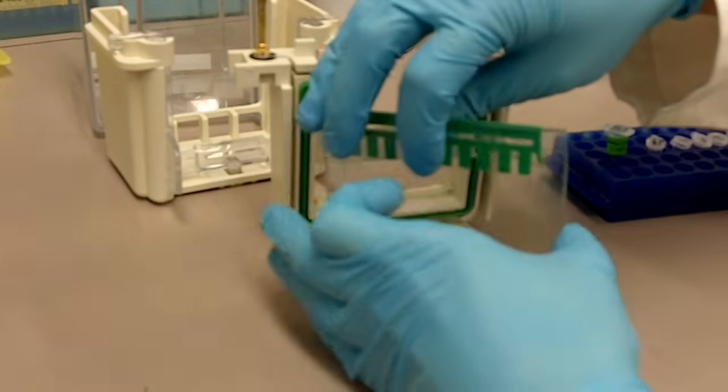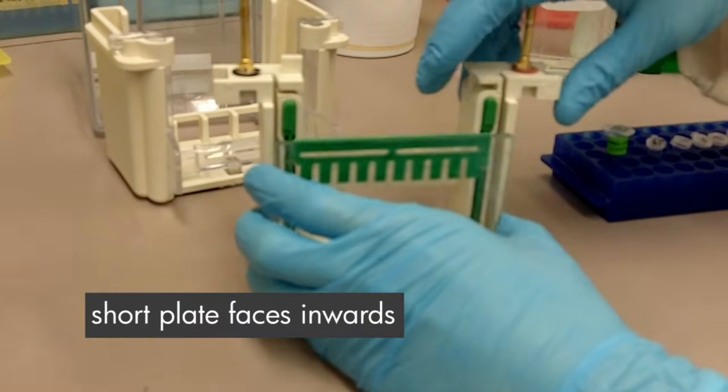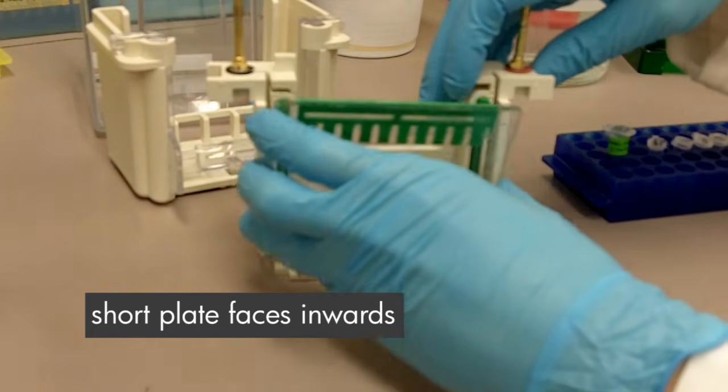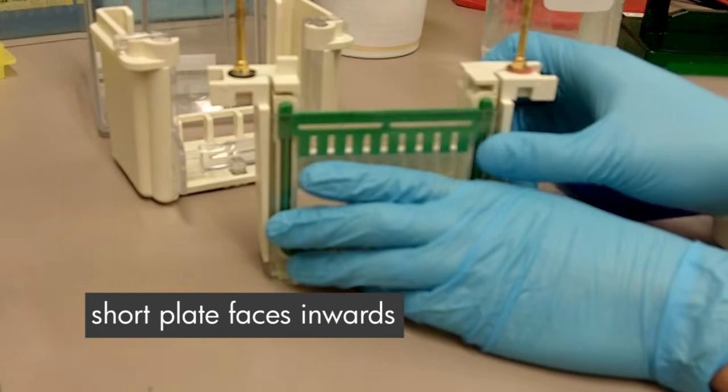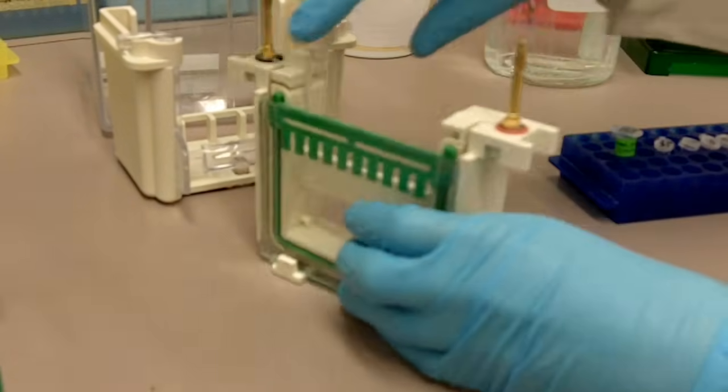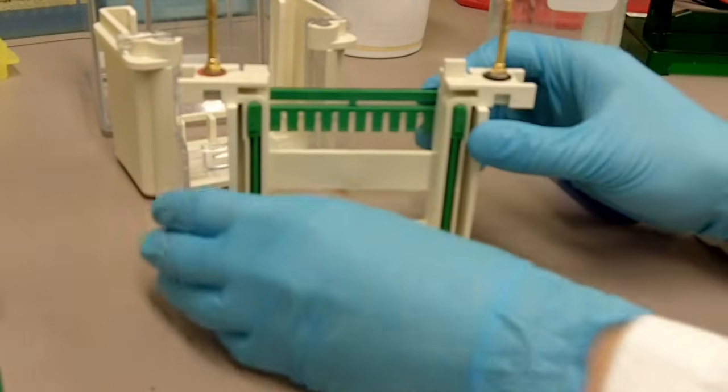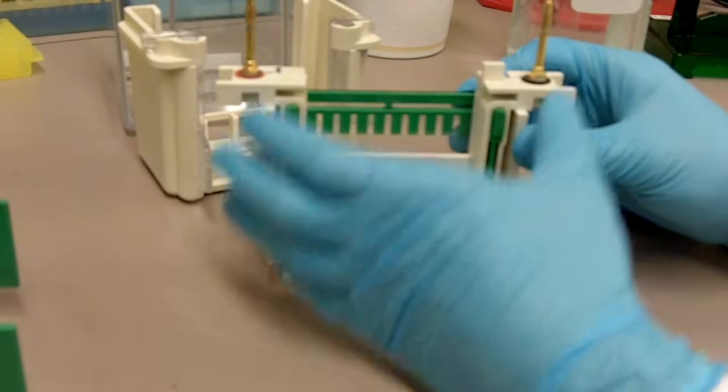Make sure the short plate is always facing the inside, so you just have to slide in like that. And if you are running two gels, you take the second glass plate and then you put it there.